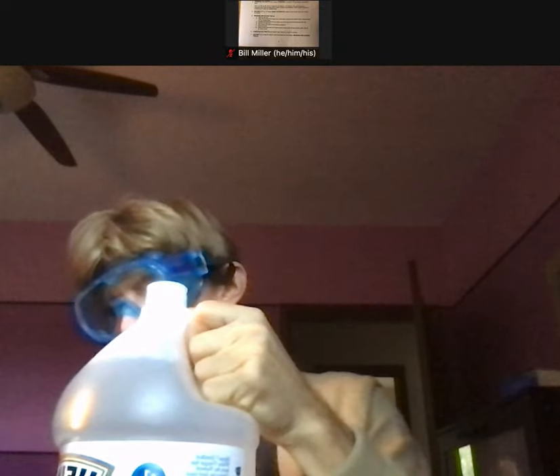I'm going to do this away from my computer. The exact amount doesn't matter because that's what the squiggly equal signs mean — it just means we need about 150. I've got it, and I've written A on this for acid. That's part one. Mine was clean and dry, so I didn't need to condition it, but you might need to.